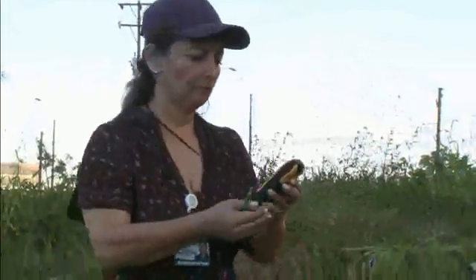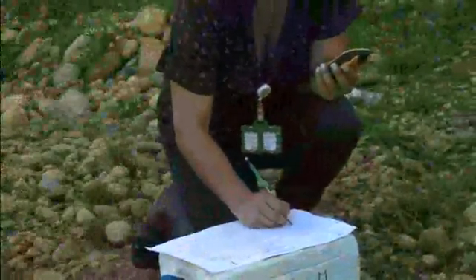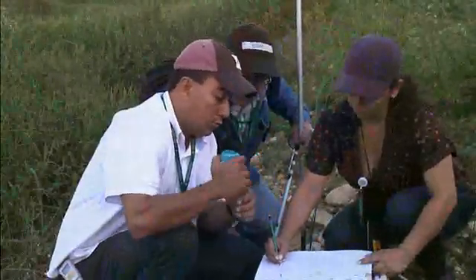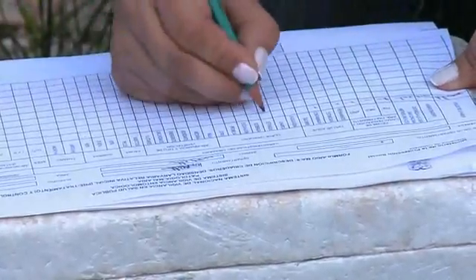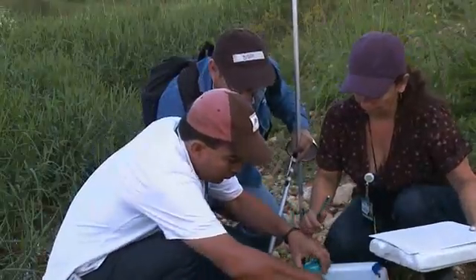Periodic sampling might be necessary to monitor mosquito densities, so a GPS unit or a sketch map showing the position of the breeding sites relative to villages and settlements may be helpful. Each sampled breeding place should have a unique number recorded in a notebook. Against this number, record the location, type of breeding place, number of dips made, and date.